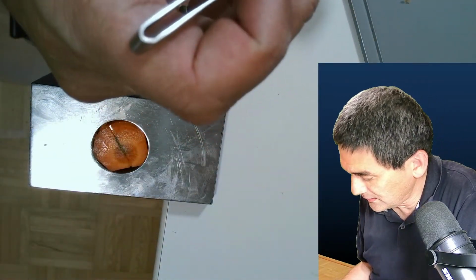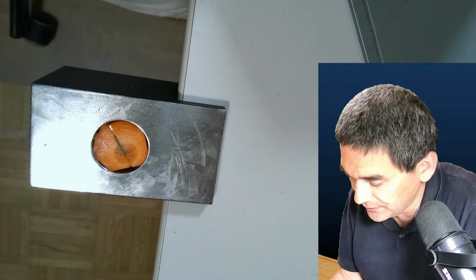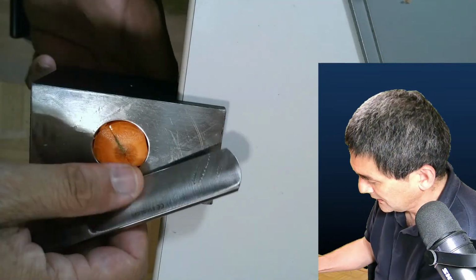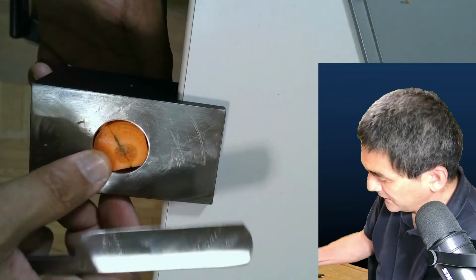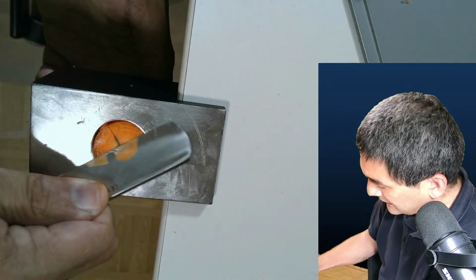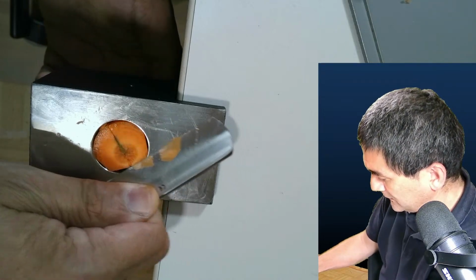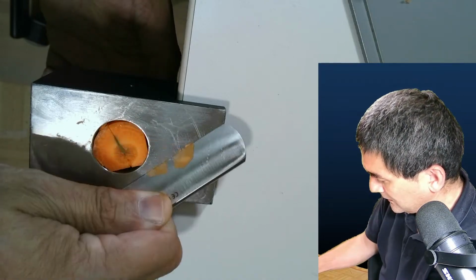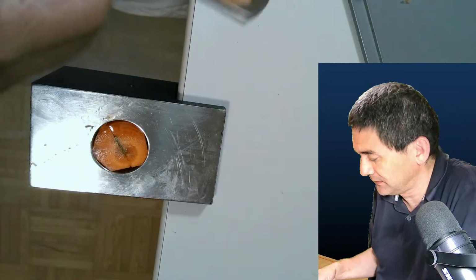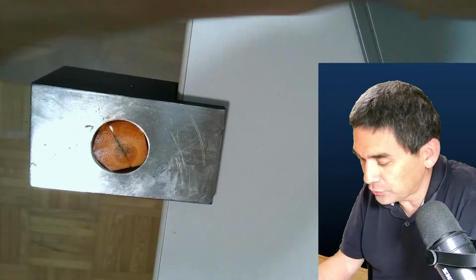Here it is. Okay, here's another one. So I put it also on here. Yeah, and you can keep on doing that. Yeah, if it's really tight, then you're actually not lifting it out either. Sometimes it's a little too thick, and sometimes you're kind of gliding over it. And maybe I need a little bit more practice in actually finding the right angle. Yeah. As so often, a question of trial and error.